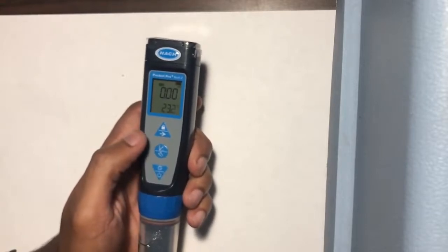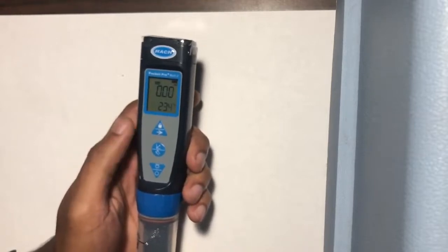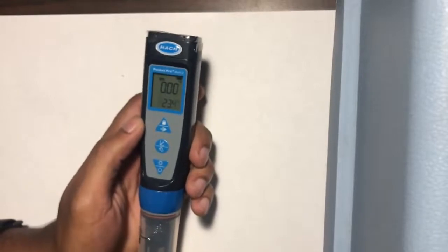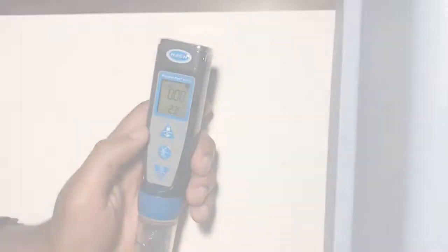This will reset all the units and parameters and the scales back to factory settings, which we use by default anyways, minus the ECAL setting, which you should probably go back and change. It is good practice to check all the settings each time before you begin calibration. Please record on your datasheet any changes you made to your meter prior to use, or any issues you had encountered under equipment notes.